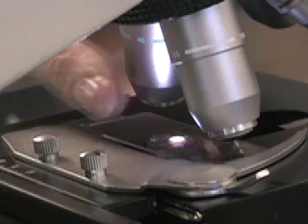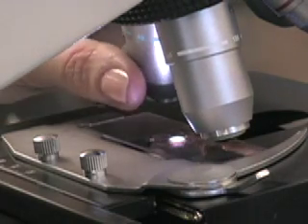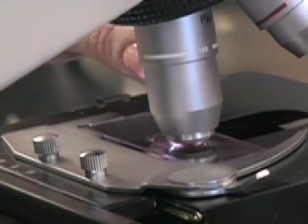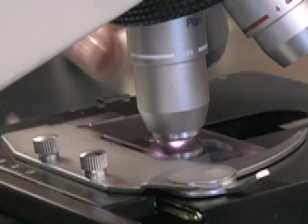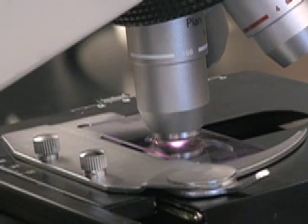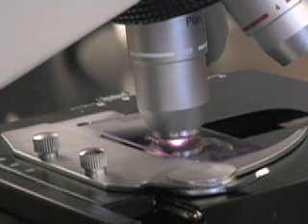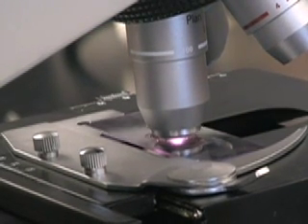It will look like your slide will break, but since these microscopes are parfocal, they won't. The function of oil is to decrease the refraction of light and generate a clear image when you focus using your fine adjustment knob.